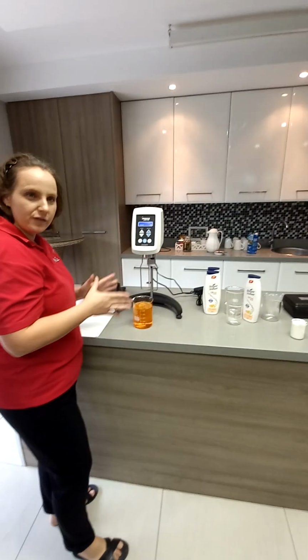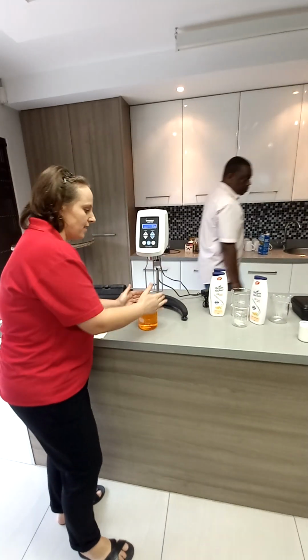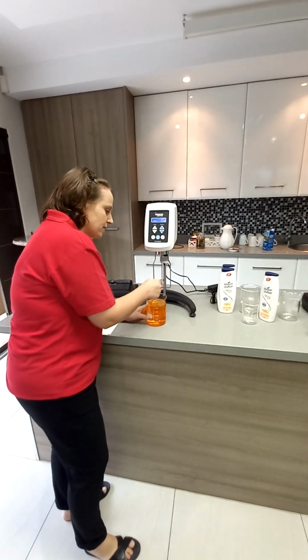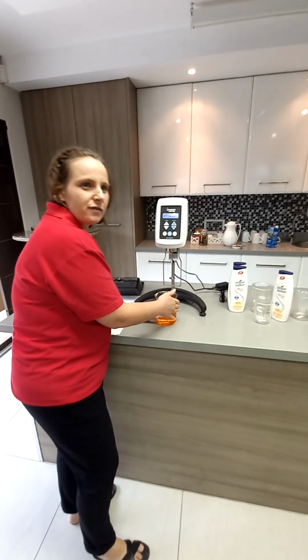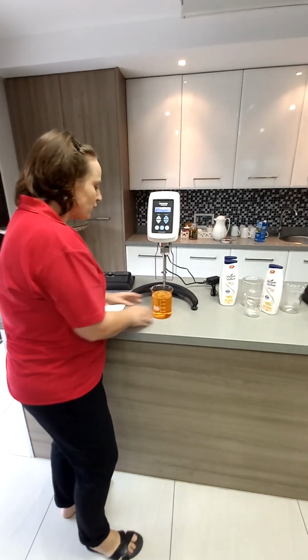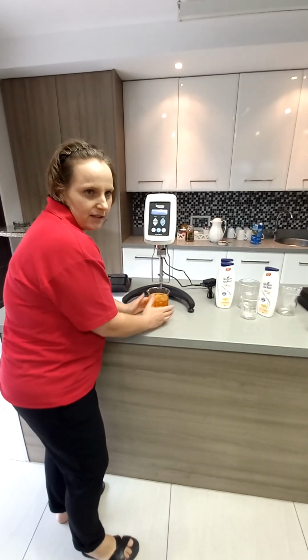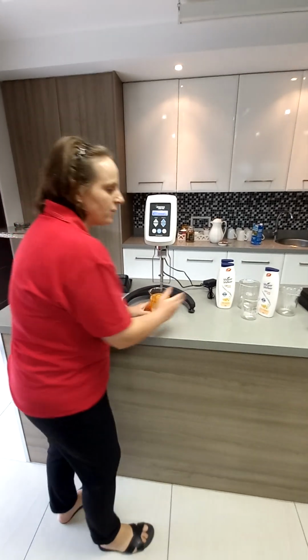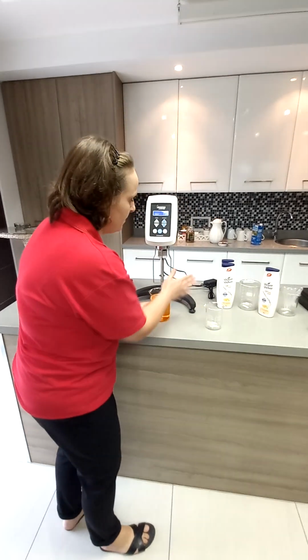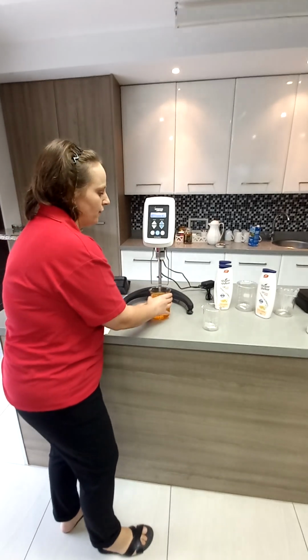The formula for viscosity is this big formula that takes into account beaker size, spindle size, how far the spindle center is to the edge of the beaker, all these parameters. But because of this non-Newtonian behavior, you don't always have to use a 600 ml. If you set up your spec with a 250 ml, that's fine. But then you can't use this guard leg. This is just to protect the spindle from bumping.